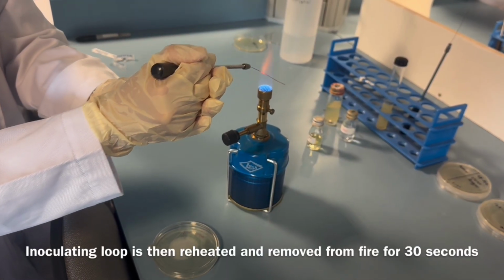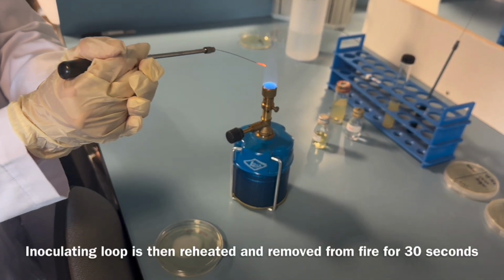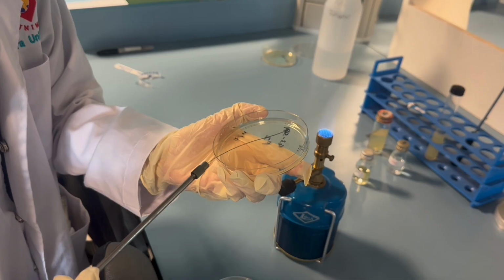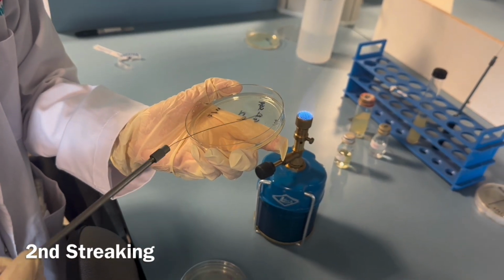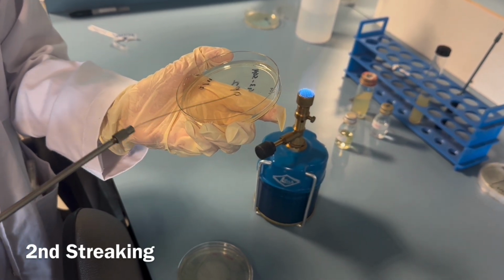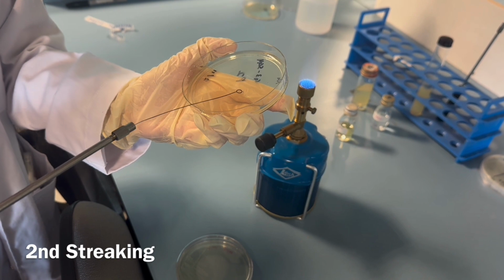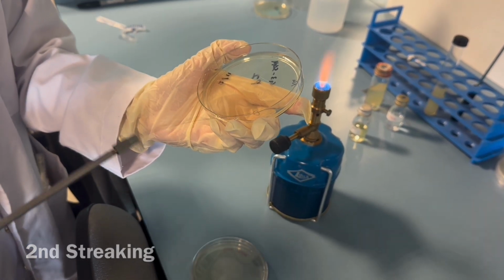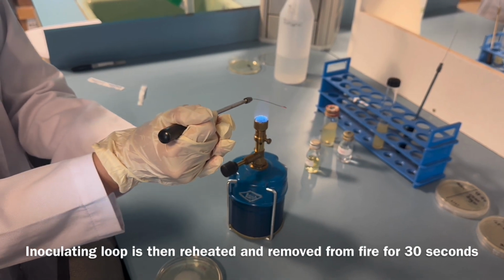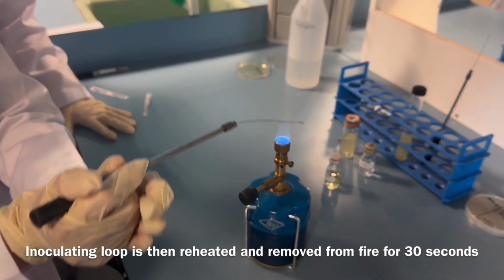And then the inoculating loop is reheated and removed from fire for 30 seconds. So second streaking is done, second quadrant. The inoculating loop is then reheated again and removed from fire for 30 seconds to do the third streaking.